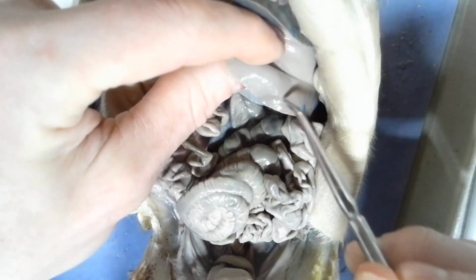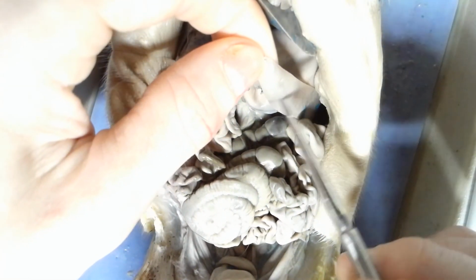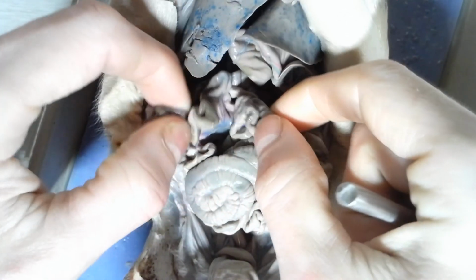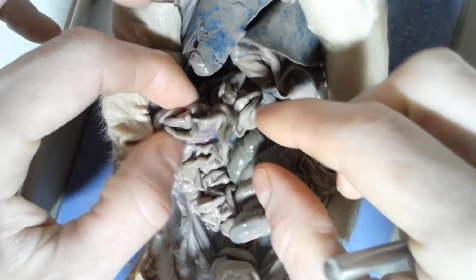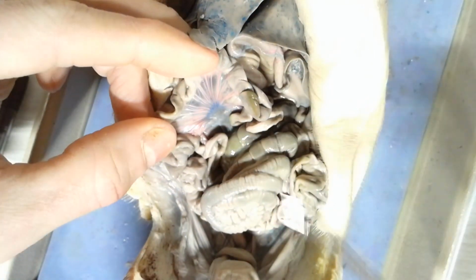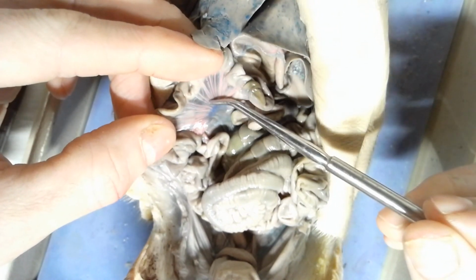Okay, on the side of the stomach, you see this very narrow organ right here. This is the spleen. Alright, moving on down to this, you see a whole bunch of small intestines. So all these really small little coiled up tubes here are the small intestines. This big clump right here is the large intestines. Now if I take the small intestines and I spread them out like this, you see that little webbing? That little webbing is the mesenteries. This is what keeps all intestines bunched up together. Mesenteries.